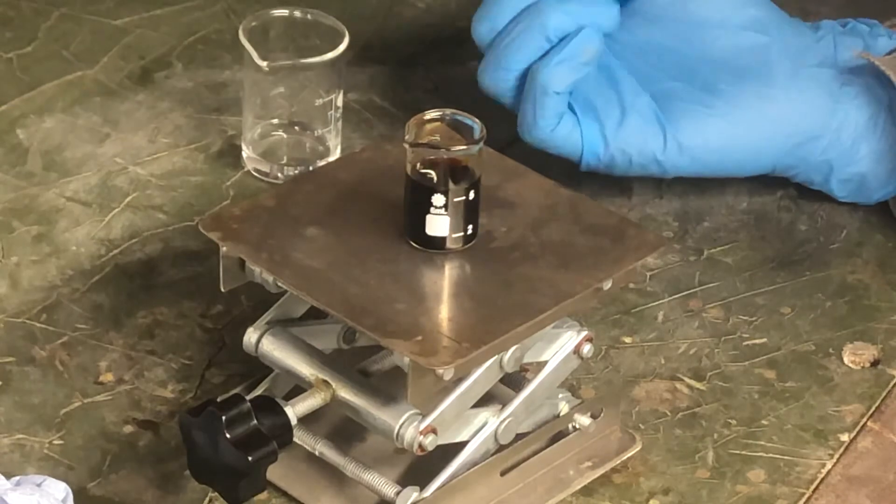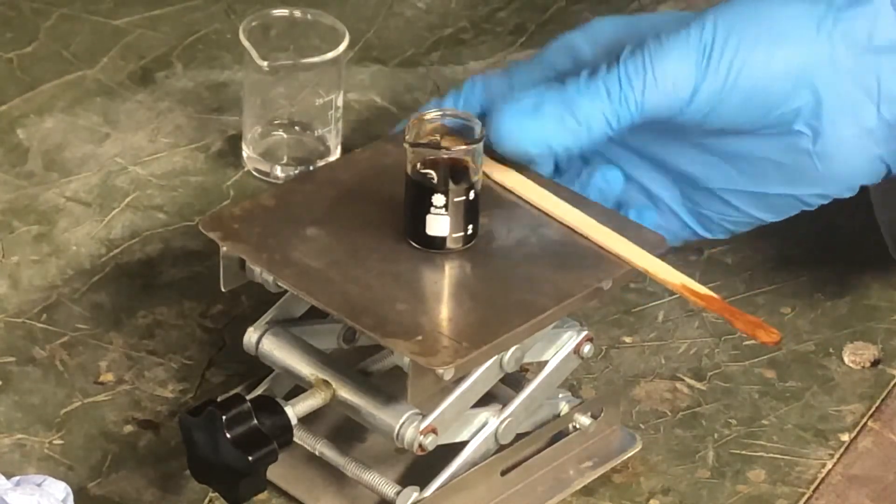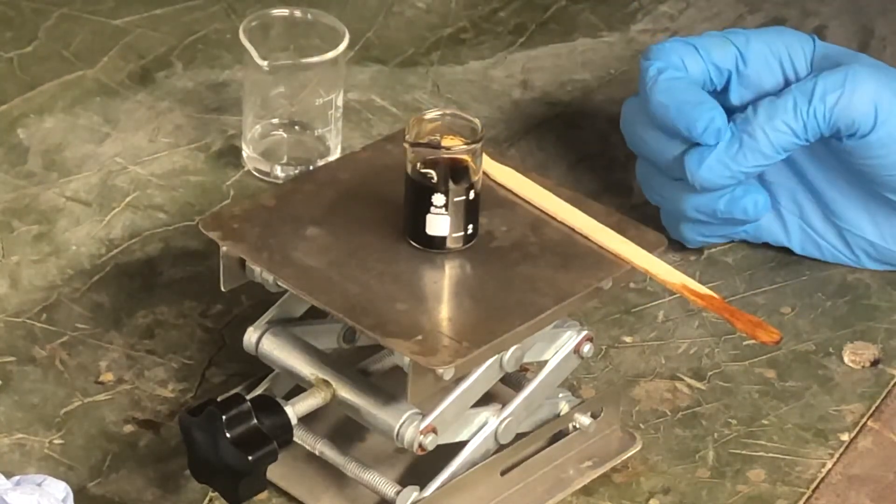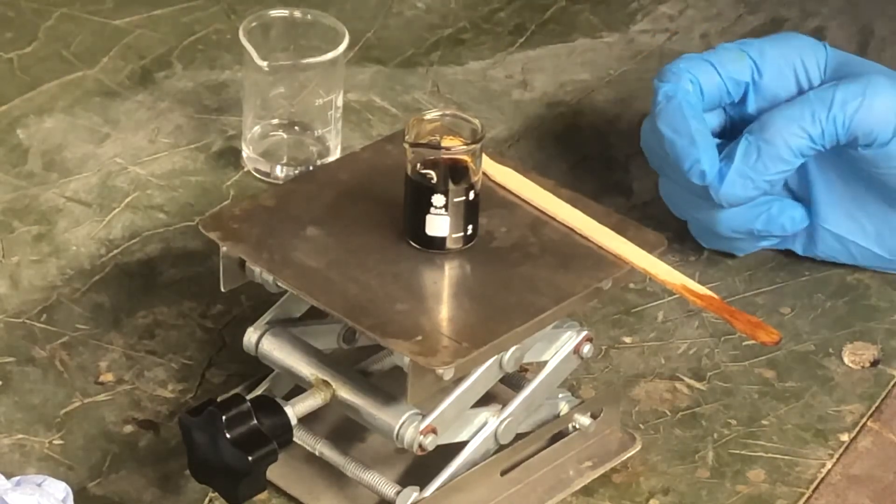But yeah, this is an organic iodine compound, which is just rather interesting. That's it. Goodbye.